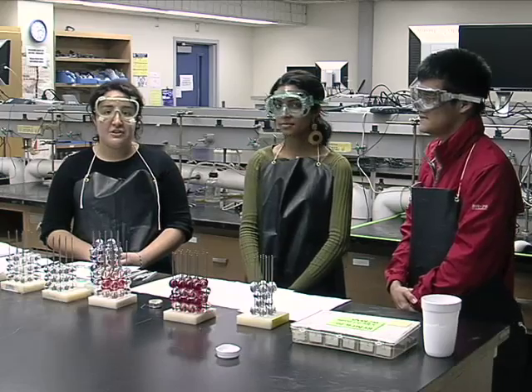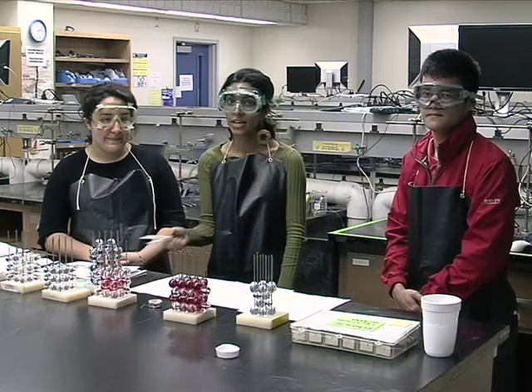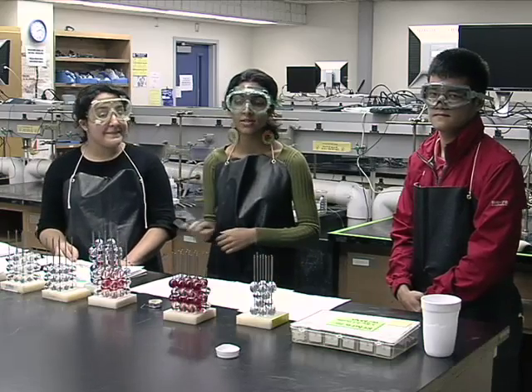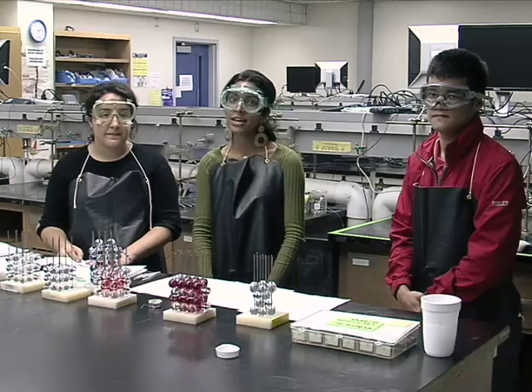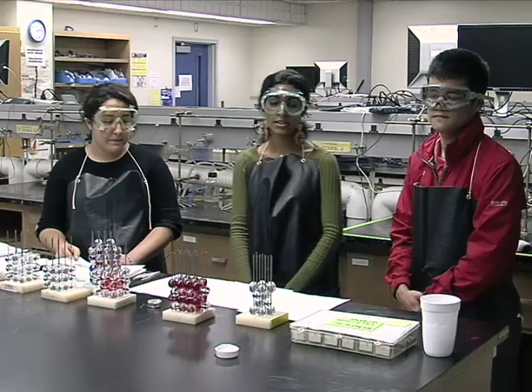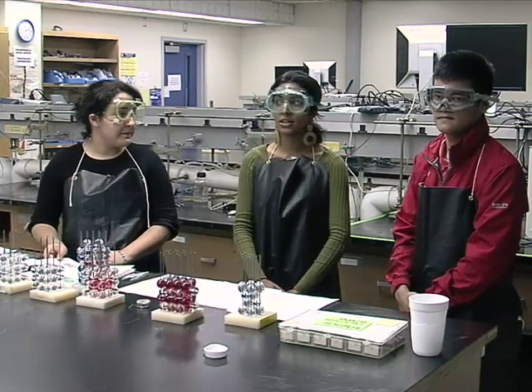I just wanted to remind you that if you put something in liquid nitrogen, make sure to wait until it returns to room temperature before you touch it. And I'm sure you don't want anything to happen to those hands of yours, so please use plastic tweezers when handling any rare earth magnets or superconductors, as they may be toxic. Also remember to wash your hands after the lab is complete and inform your TA if any spills or other accidents occur.